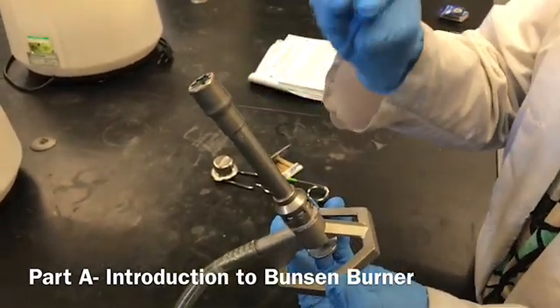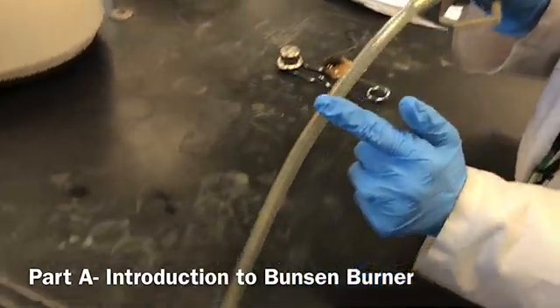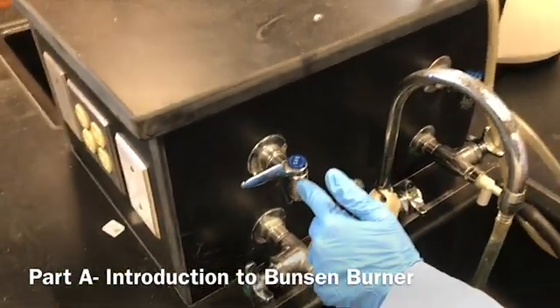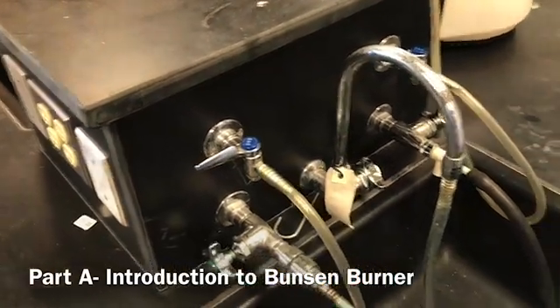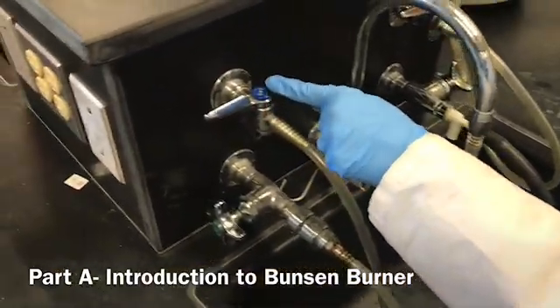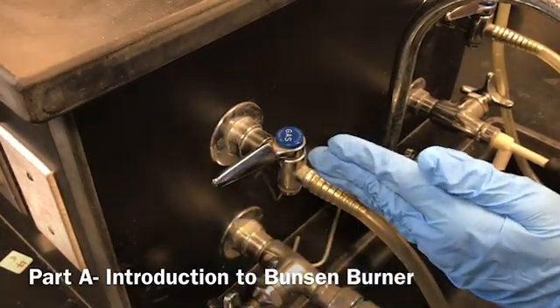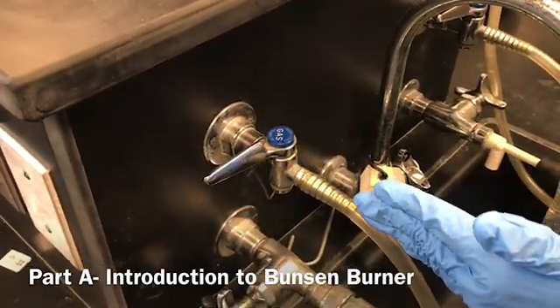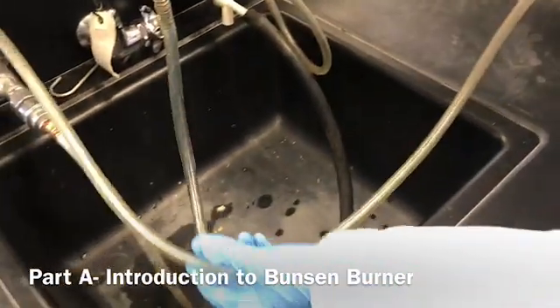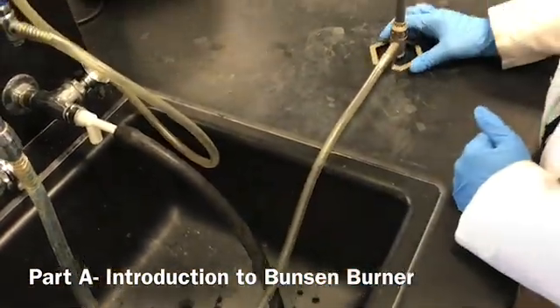Methane and oxygen both mix together before reaching the flame. This pipe is connected to the main gas valve, so methane gas from the main gas valve comes to the burner through this pipe. Right now the main gas valve is completely off; when I move it 90 degrees, aligned with the pipe, it will be completely on. Make sure there are no cuts or cracks in the pipe.